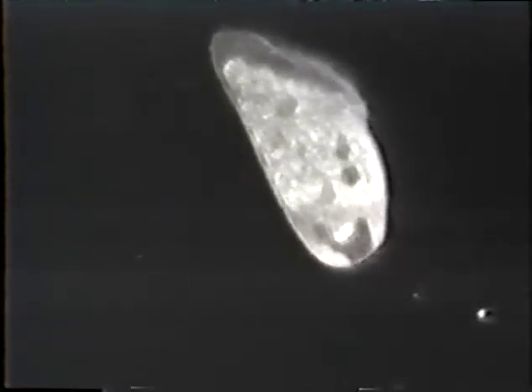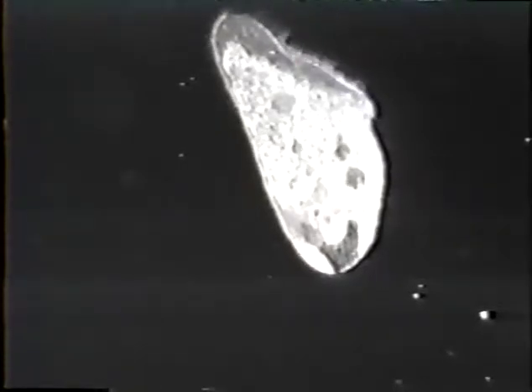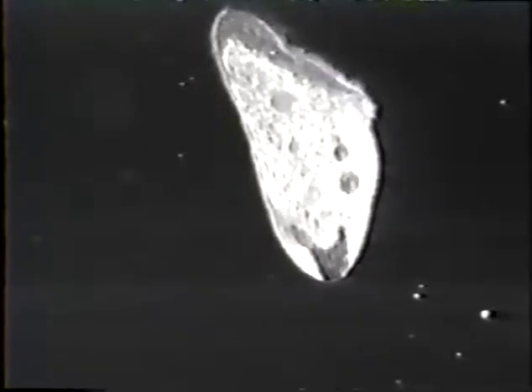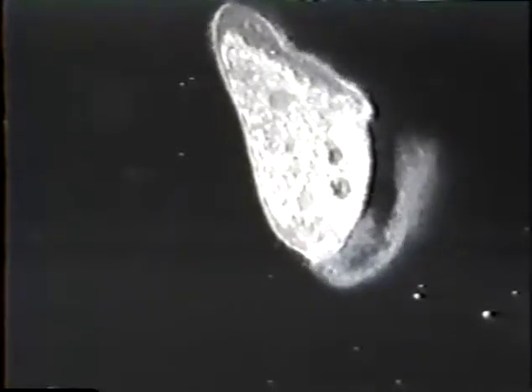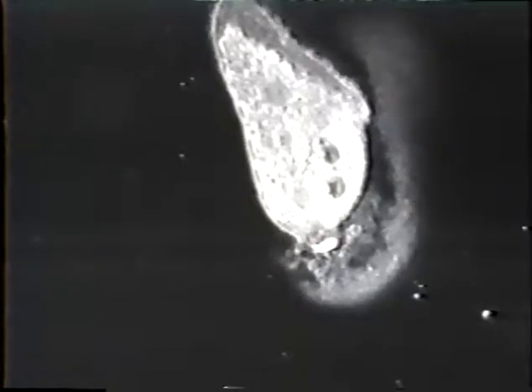This is another blepharisma. Typical also of the blepharisma is that the cell wall somehow becomes permeable to the surrounding fluid media, and the organism will swell. Also, they will stop motion. Normally, these are very highly motile and swim quite rapidly across the screen. But as you can watch here, it just keeps getting a little bigger. Finally, they blow out at the bottom. This seems to be pretty standard behavior for this type of explosion or disintegration.